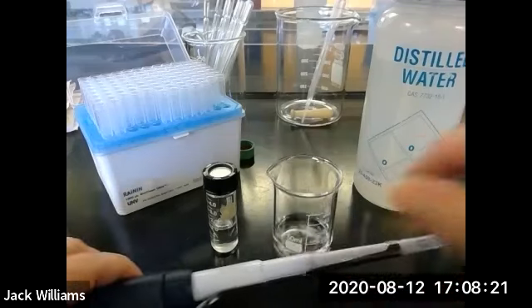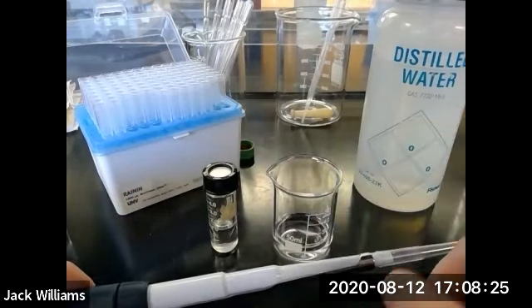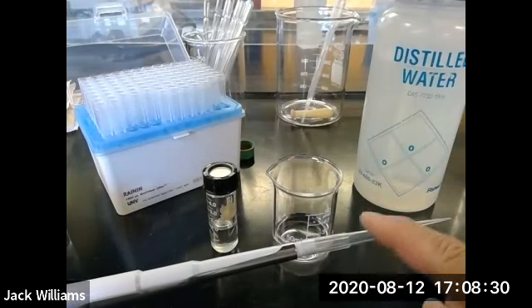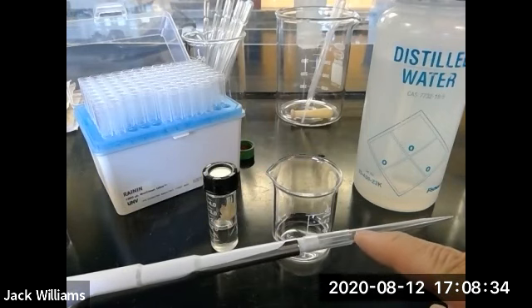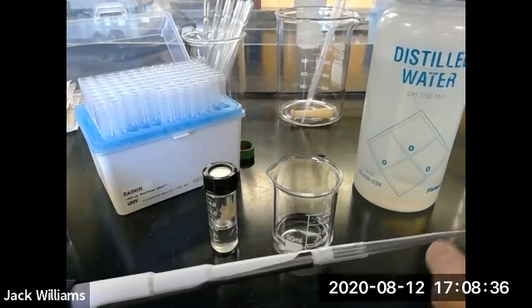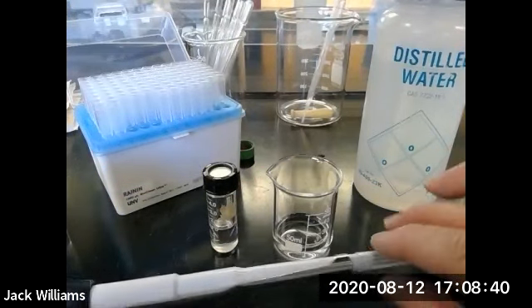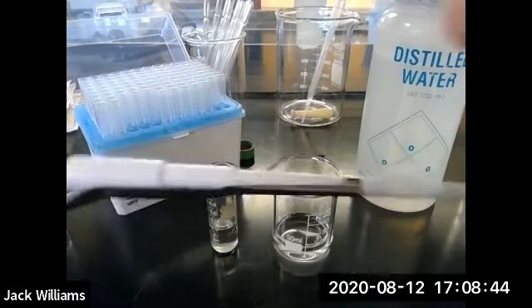Okay, now I didn't change the tip. You say, well, why didn't you use another tip? Well, in the time that it took me to dissolve the benzoic acid, I guarantee there is no methylene dichloride in this tip because of the volatility of the methylene dichloride. So for this particular procedure, you don't have to change the tip. There's nothing on the surface. You can check to make sure it's secure. It's already preset for 600.